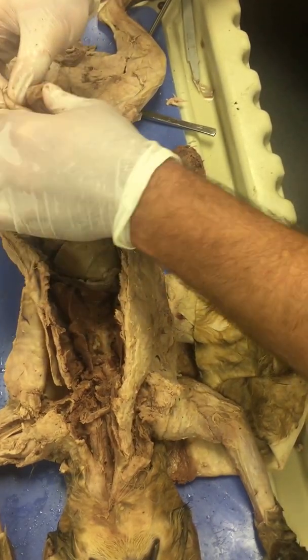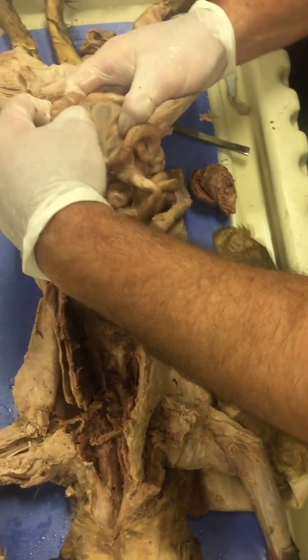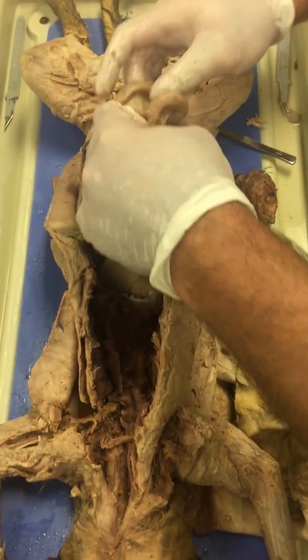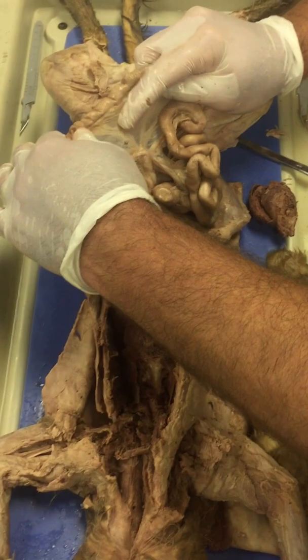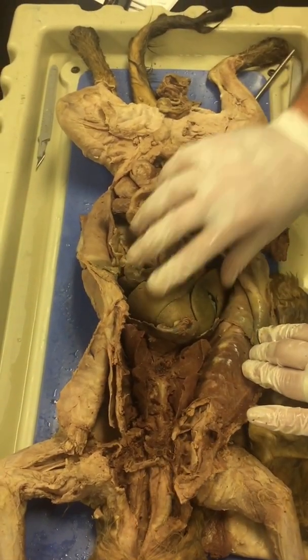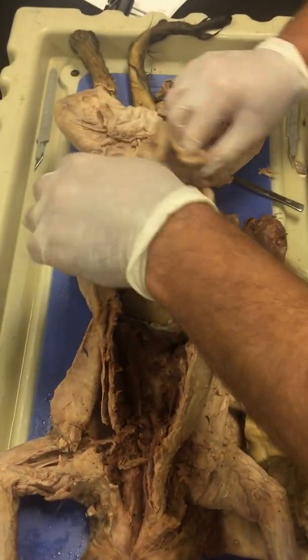Okay, so this is the ileum, and you can really see this kind of stained glass opaque layer that holds all the intestines together. This is called mesentery tissue. Its primary function is to keep the small intestines from coiling up, kinking, and folding on itself. It also aids in absorption, so you can see that there's a lot of blood vessels that extend through the mesentery. Basically what it does is it takes everything that's absorbed up to the liver for processing before it's distributed out to the body. Alright, so let's get back to where we were here.